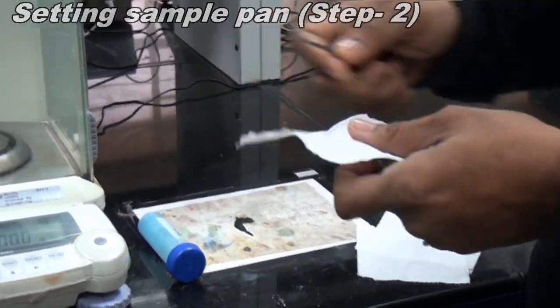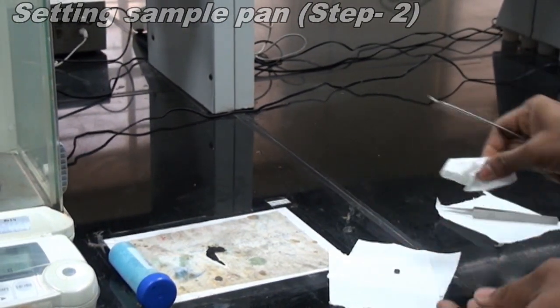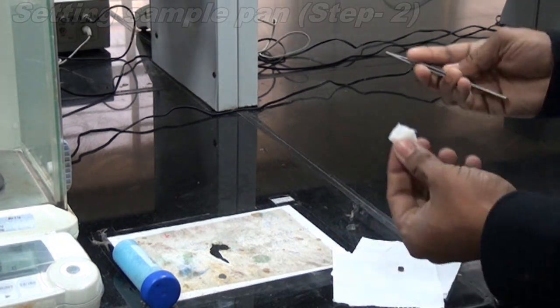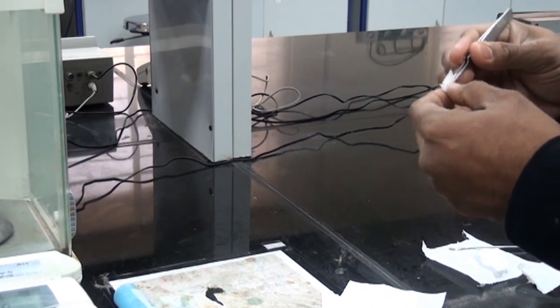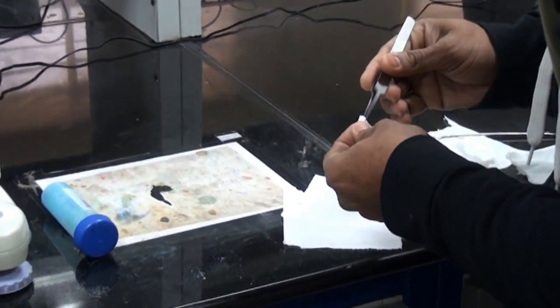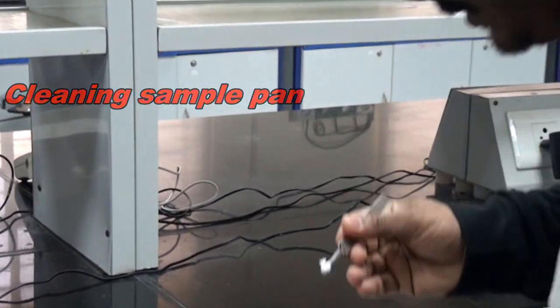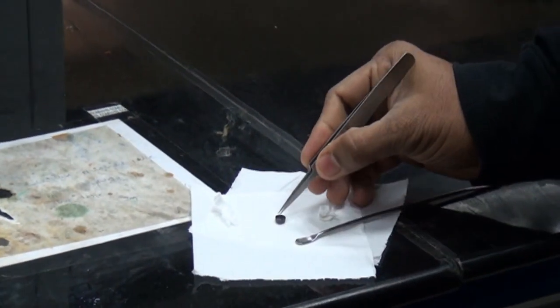If it is not clean, you have to clean it with tissue paper to ensure that it is clean. If the sample pan is not clean, that also you have to clean using forceps. I have taken a small tissue paper, held it with the forceps like this, and I'm keeping it inside and rotating it with the help of the forceps. After cleaning both, I am keeping this one on the weighing balance.